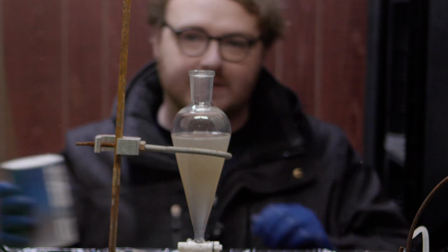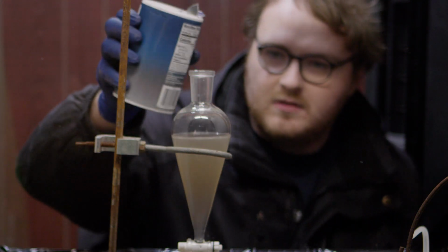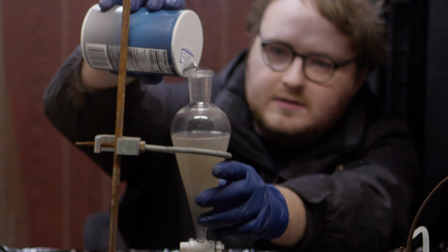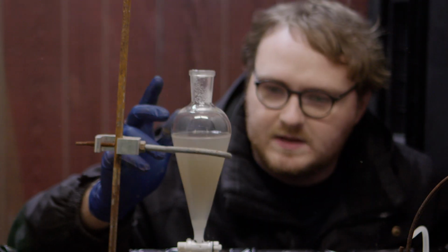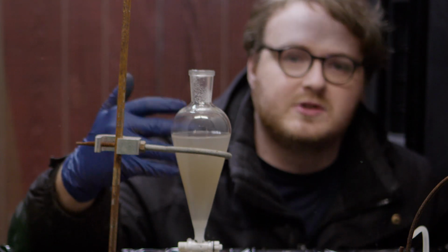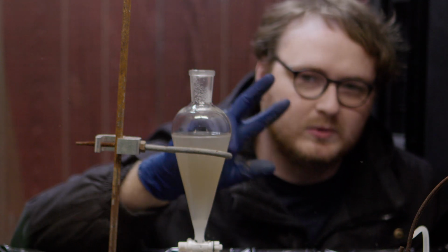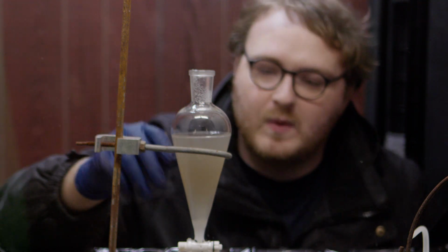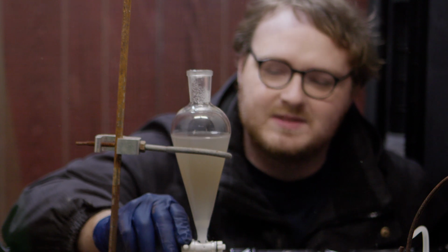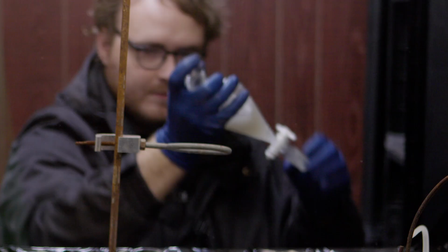I'm going to go ahead and add a little bit of salt. This is just sodium chloride. The sodium chloride, this isn't lab grade, unfortunately. Basically what the salt does, the sodium chloride, it dissolves in the water and creates a bunch of sodium and chloride ions, and those ions sort of increase the polarity. It's probably way more complicated than I even understand, but I just sort of remembered that they increase the polarity of the water, and that makes it so the toluene does not like to stick around. Okay, it's all dissolved.